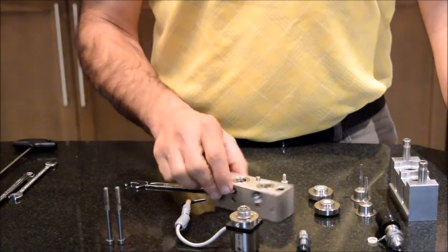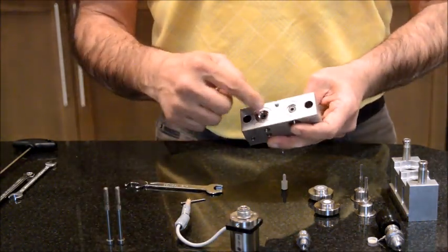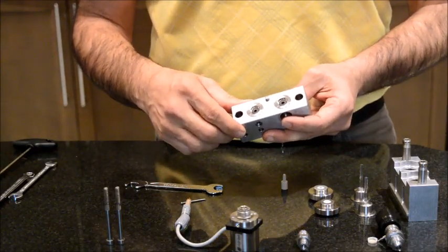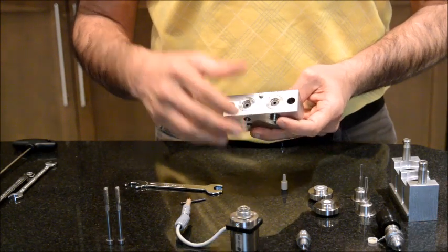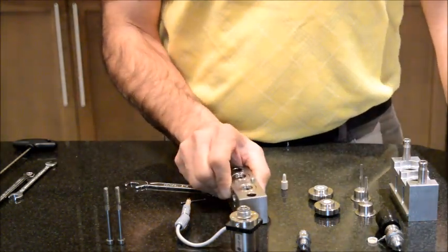If you want to use a high concentration of THF, you should go to metrology and tell them to replace these pump seals with THF compatible pump seals. So they will make your HPLC THF compatible. But these pump seals are not meant for THF.